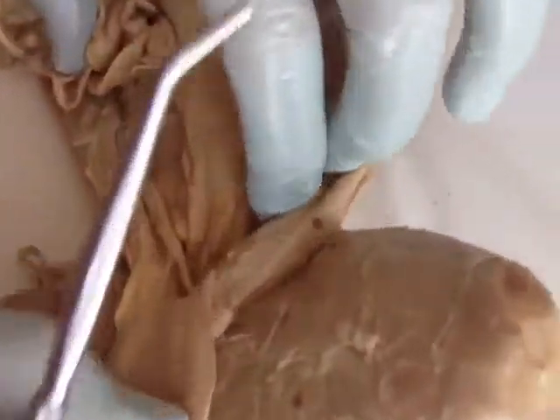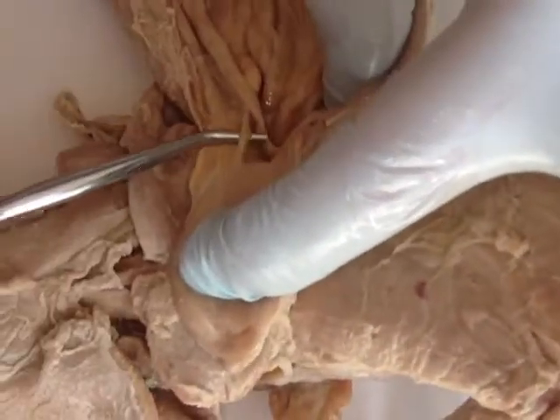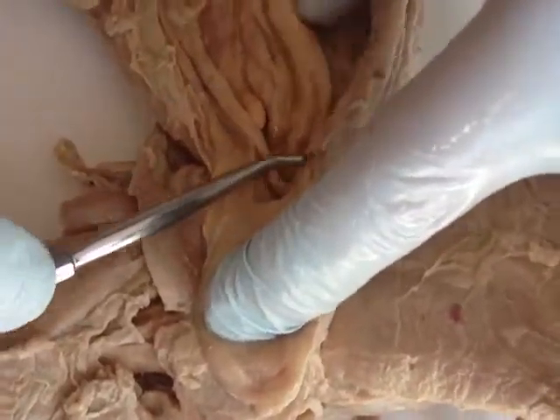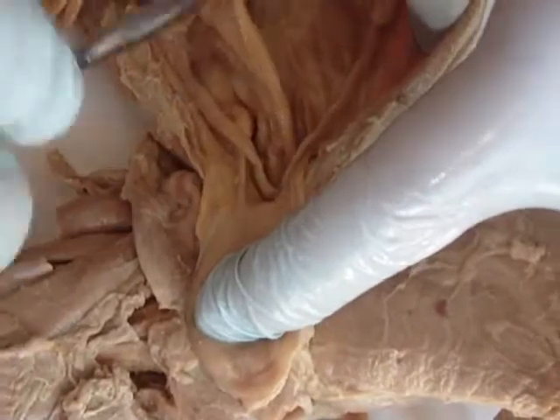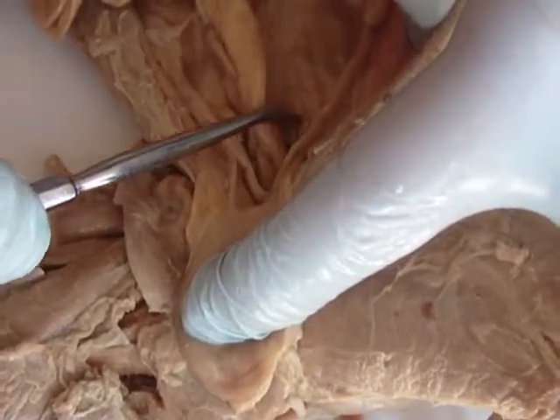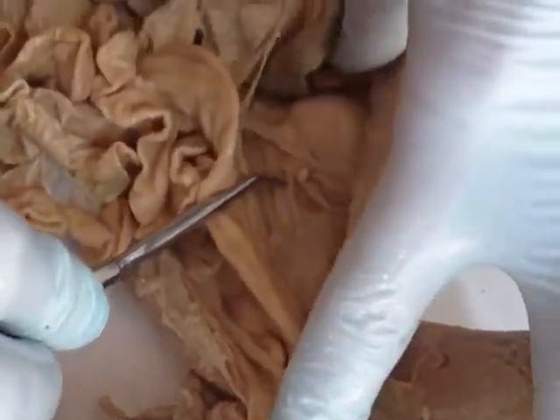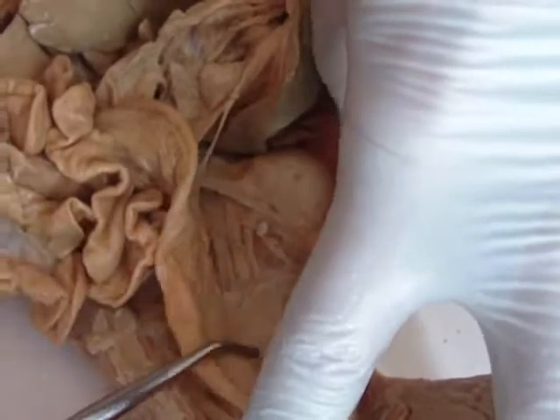Bladder — put your bladder back. You can see these little ureters here; you can take that ureter, follow it all the way up, and you see your kidney.